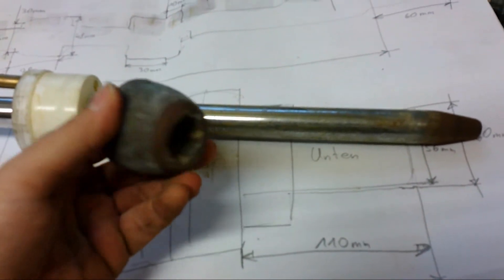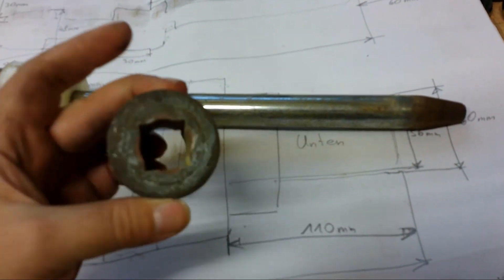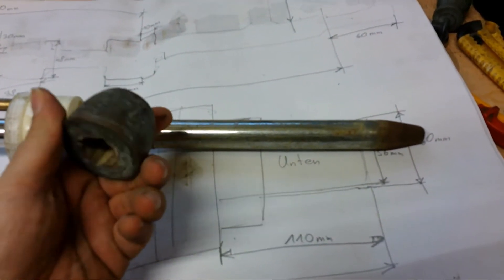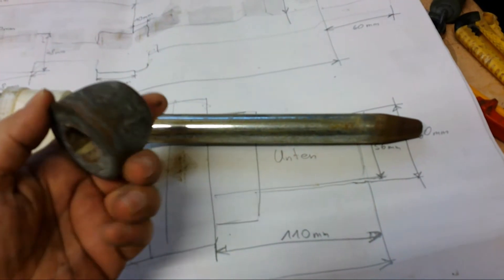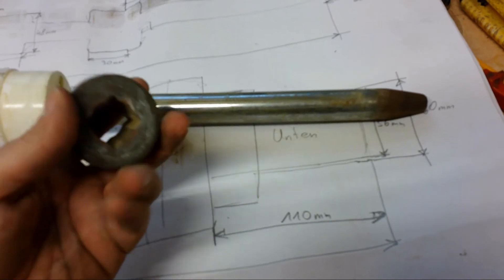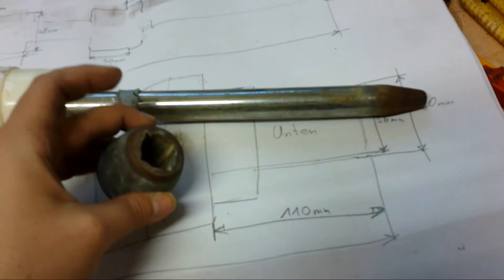I have managed to disassemble this part here. And actually I think I will reuse it because I don't see a reason why to not reuse it. It is made out of brass and I just need to give it a clean and it should be fine.